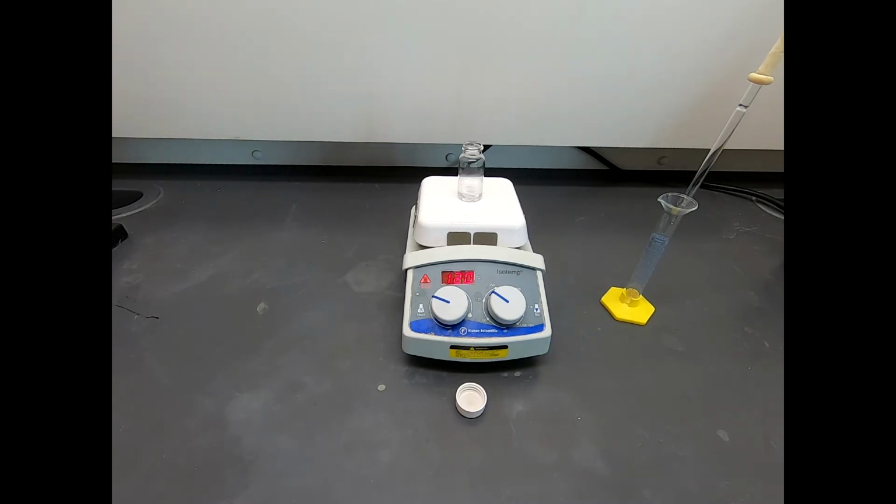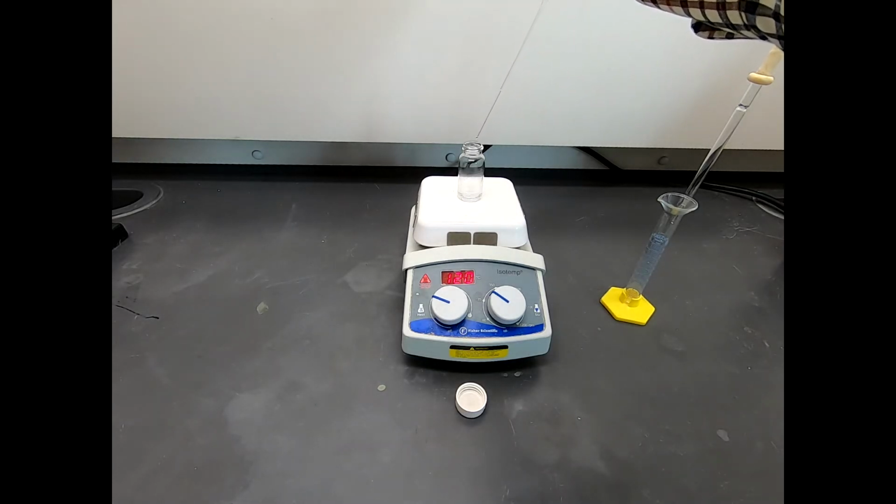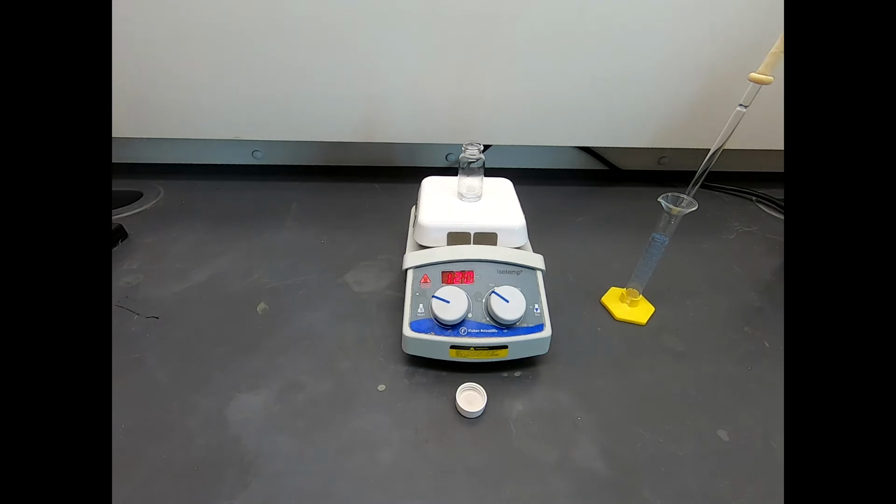The glacial acetic acid, just make sure that we have a little bit of proton source in here just to facilitate whatever the reaction wants. I'm going to blow out these bubbles. I'm not going to count that, but there's good 1, 2, 3 drops. And you might say, wow, that is not very precise. Well, the fact is, this is just a catalyst, and it is just helping the reaction.